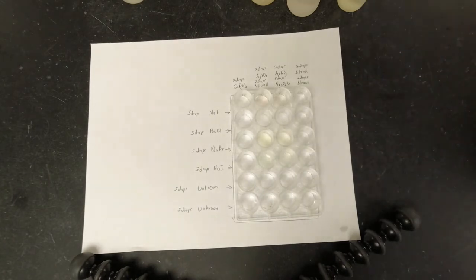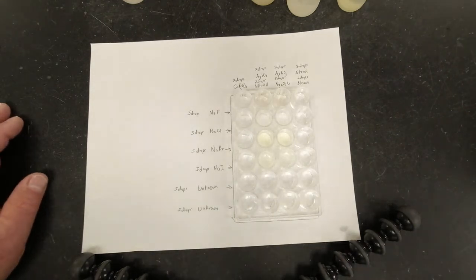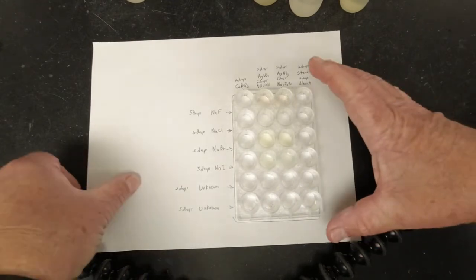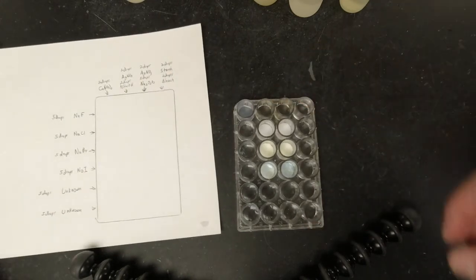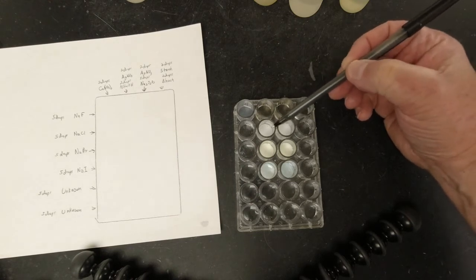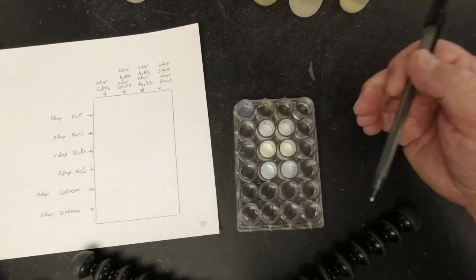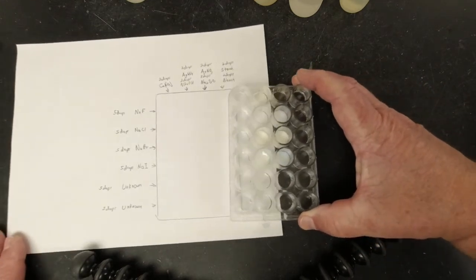All right, and so when we look at this, I don't know if you guys can tell or not from this, but we actually got precipitates in some of these. So now, if we look at this with just the silver nitrate, the first two had no reaction at all. There's a white precipitate. That one's kind of a yellowish, maybe yellowish green precipitate. And this one's kind of a grayish white, light gray. Maybe got a tinge of blue to it in there. All right, so write those down if you need to.